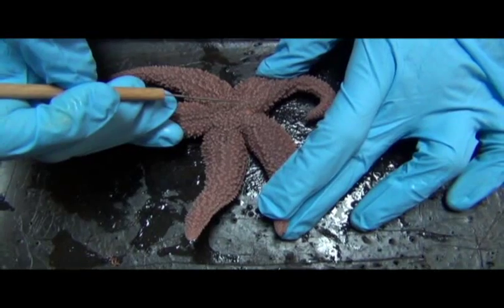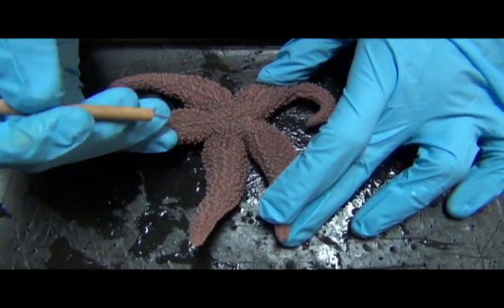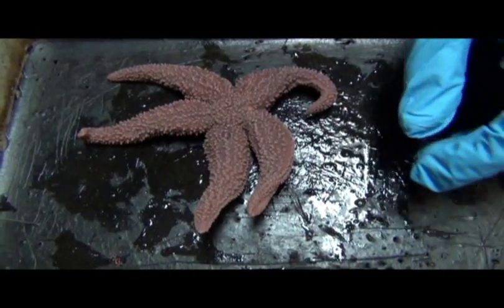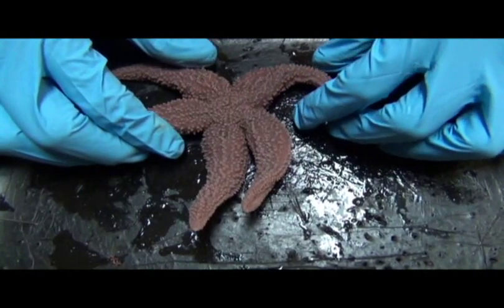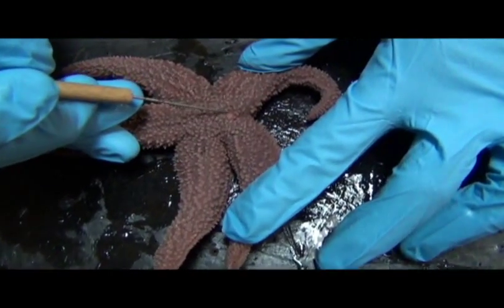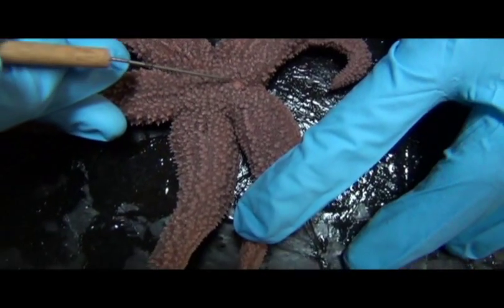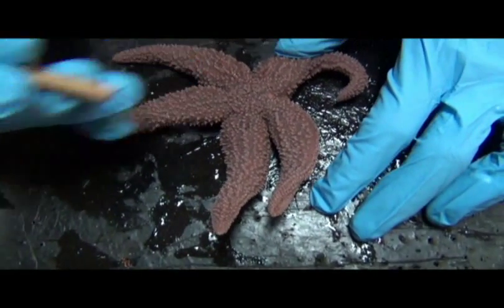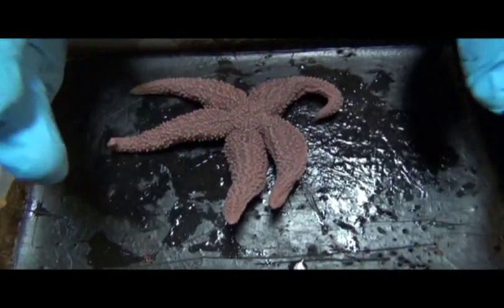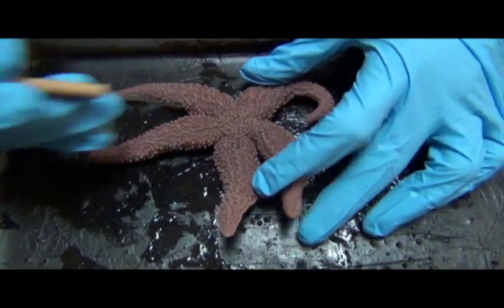If this animal wants to become more mobile, water will leave out this same hole, making the animal a little bit more limp so that it can crawl around and hunt and be more maneuverable. And so this little cap right here is really important because it's the major access to the internal plumbing system that we will see in a moment. That's probably the biggest obvious structure on the outside, on the aboral surface.